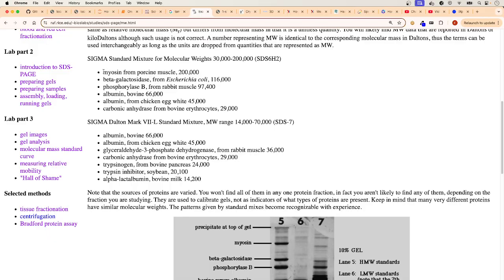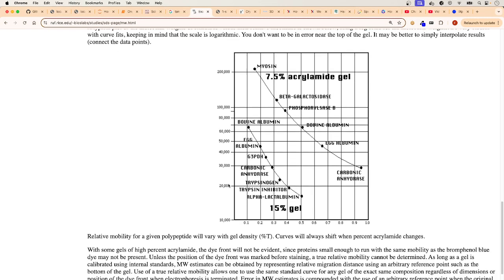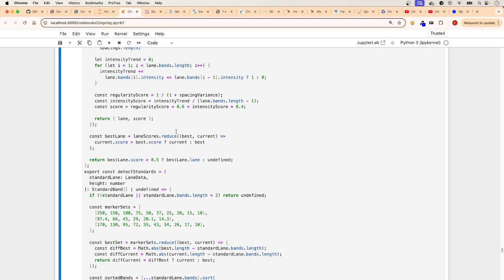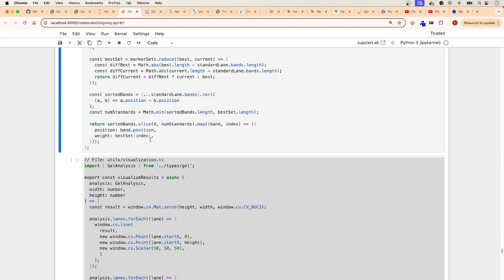position. You know that myosin should be that. So you know that if it's here, it's that one, right? Because you have the calibration standard for each one. So that's where those numbers are coming from. So we continue. This is a very important file there.